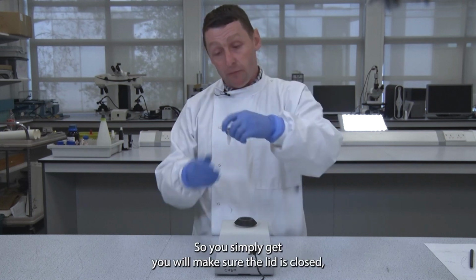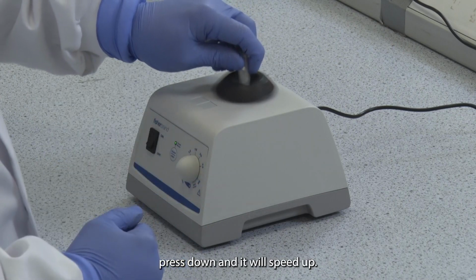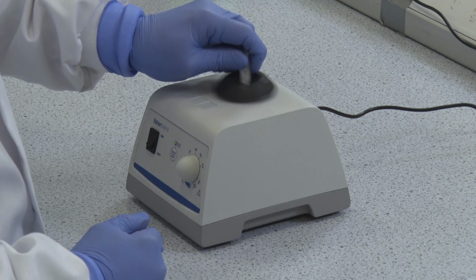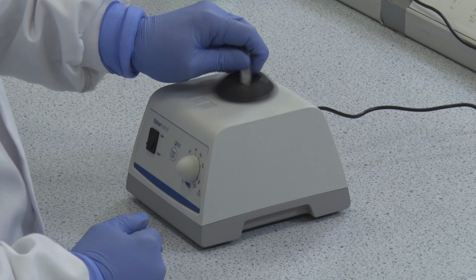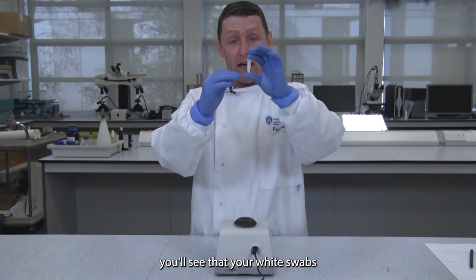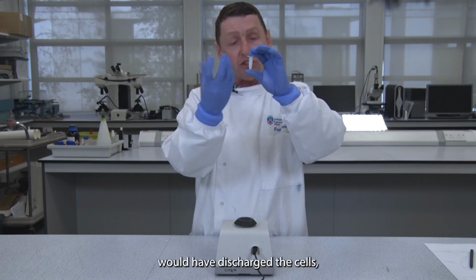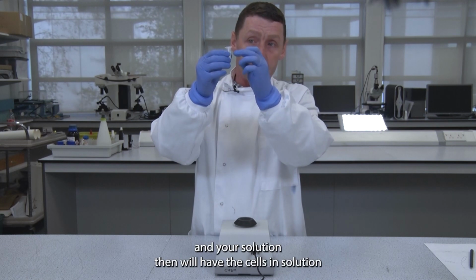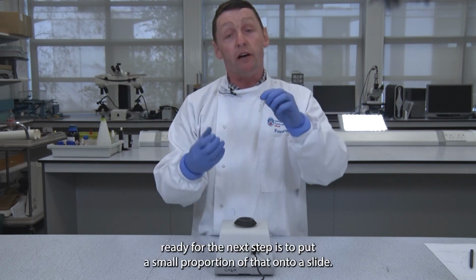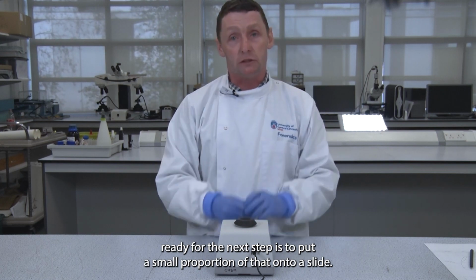So you simply make sure the lid is closed, press down, and it'll speed up and you do that for 30 seconds. Once your 30 seconds is passed, you'll see that your white swabs would have discharged the cells, and your solution then will have the cells in solution. Ready for the next step is to put a small proportion of that onto a slide.